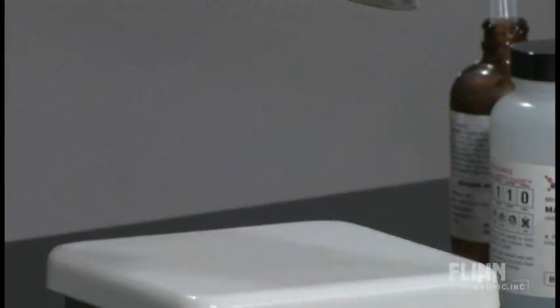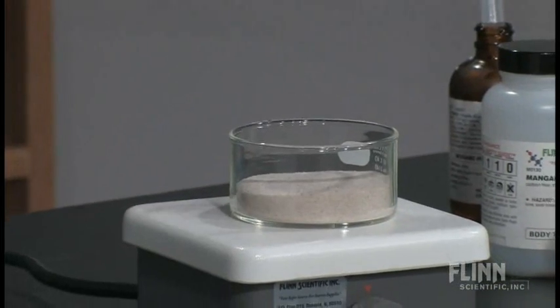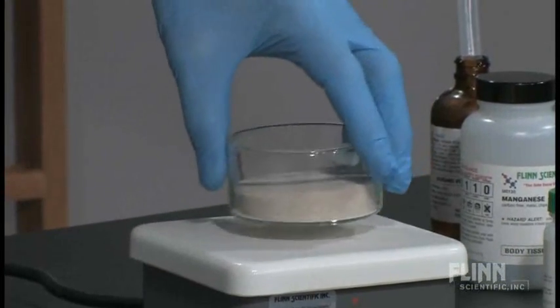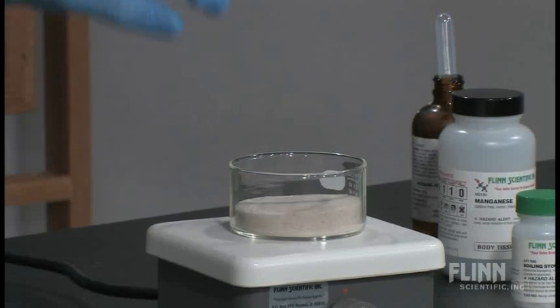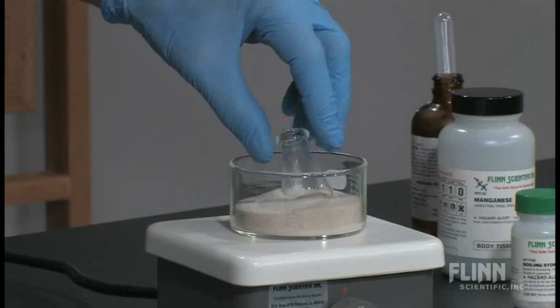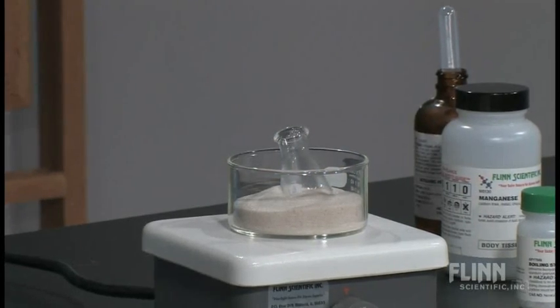Hot plate with a container, either a Pyrex beaker or you can use a tuna fish can or whatever works for you, and set some sand inside that. Set it on the hot plate. You can crank the hot plate up to the highest setting, and then set your container down inside there and let it heat. You've got a sand bath.